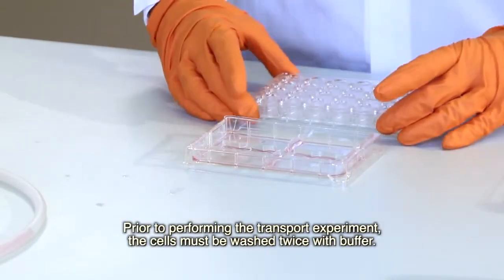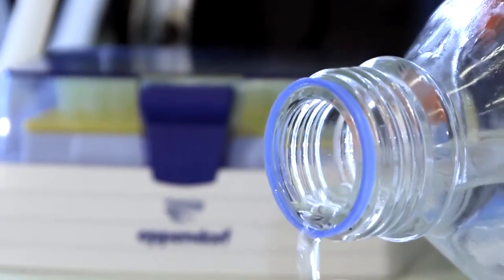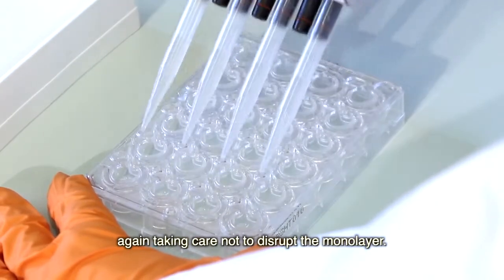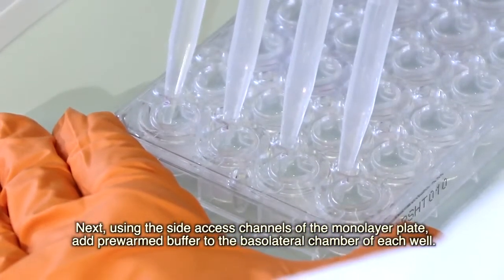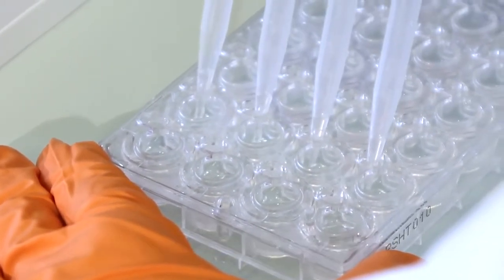Prior to performing the transport experiments, the cells must be washed twice with buffer. Using a multi-channel pipette, add pre-warmed buffer first into the apical compartment, again taking care not to disrupt the monolayer. Next, using the side access channels of the monolayer plate, add pre-warmed buffer to the basolateral chamber of each well. Aspirate as before and repeat to wash the cells twice.